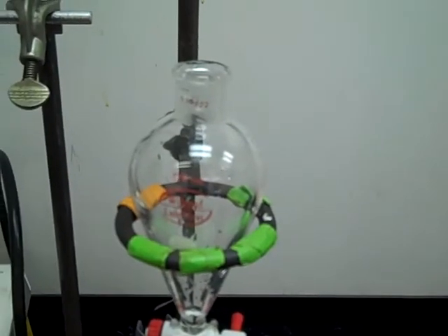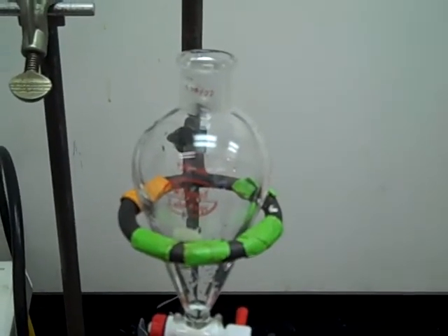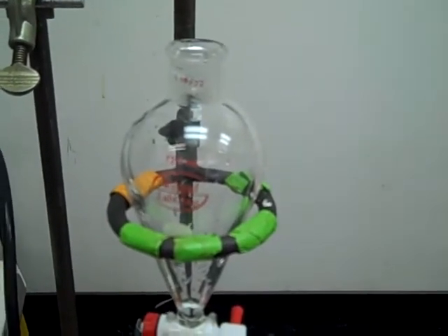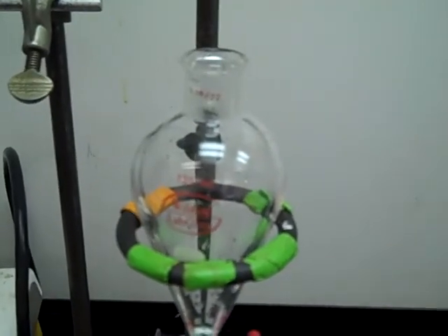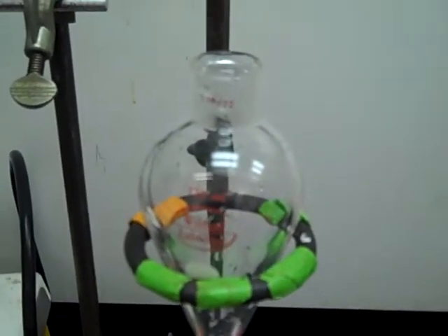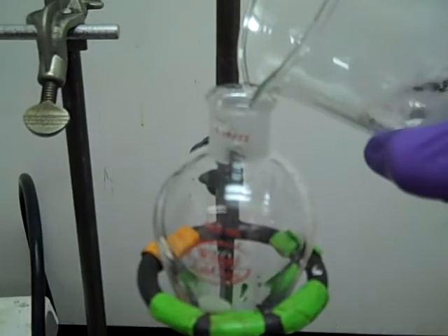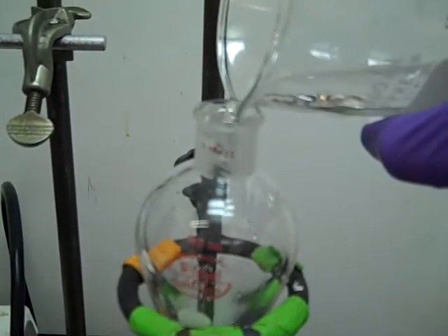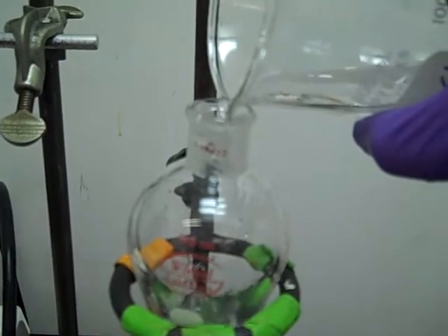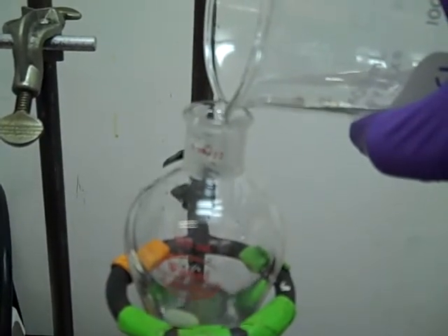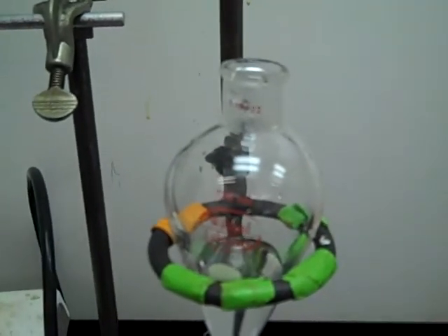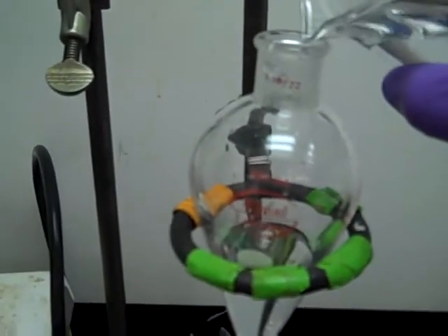So we're going to start using the separatory funnel, which means we've got to add both of our immiscible liquids into the funnel itself. So we've got our organic layer, which in this case is dichloromethane, which also contains an organic product. And then we also have our water layer.